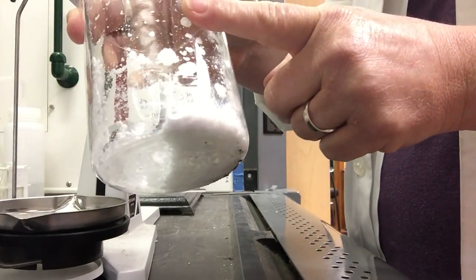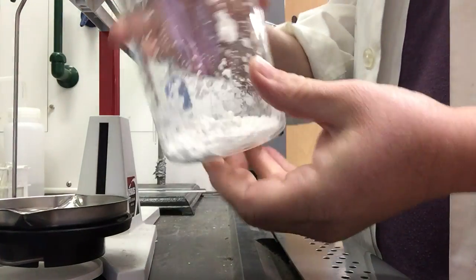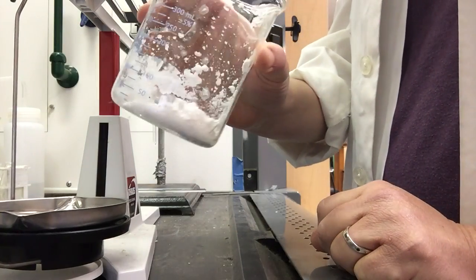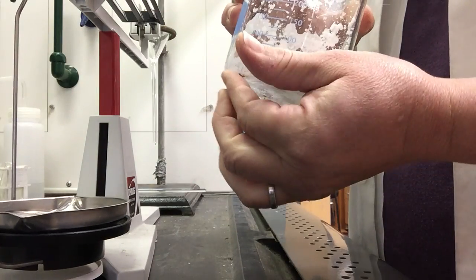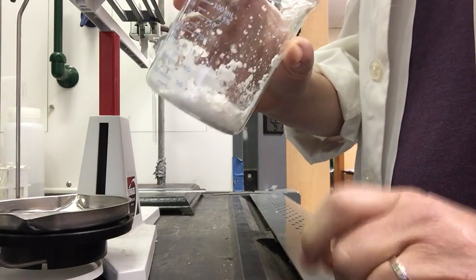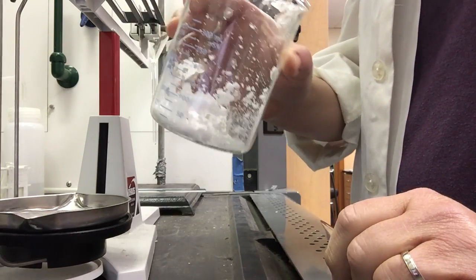So I took the mass of this beaker previously and recorded that in my lab, so now I'm going to go ahead and mass the beaker with the recovered sodium chloride. And it looks like I've got a little bit of stuff on the outside of the beaker. I want to make sure I get rid of that just because it's a little bit of extra mass.